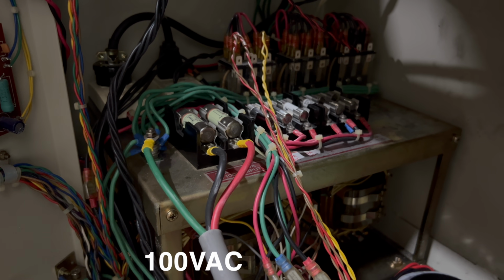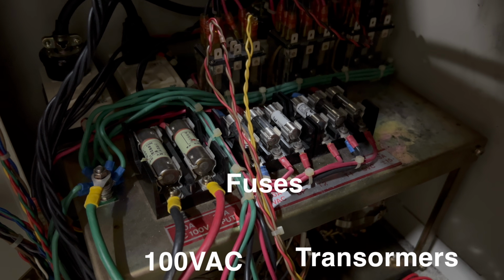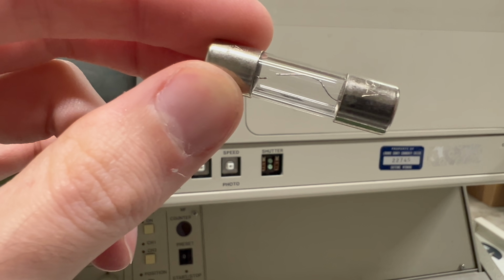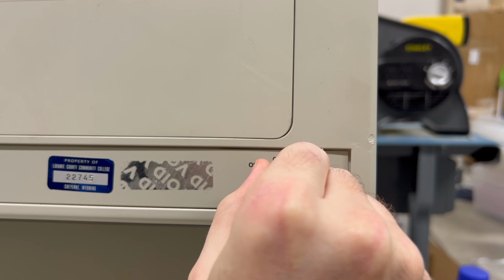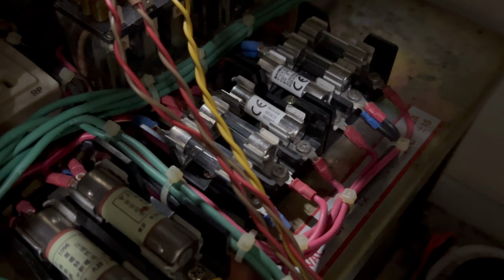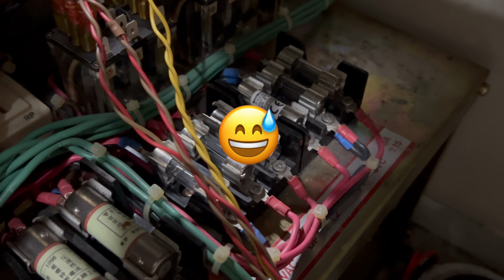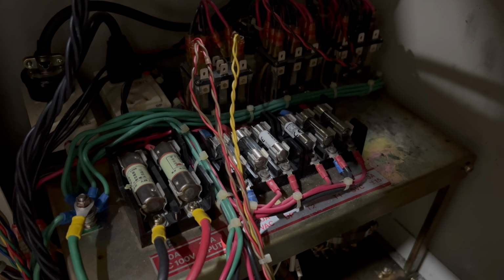It looks like the 100 volts comes in here, goes through a couple of fuses and a couple of transformers, which feeds a bunch of different power supplies. Well, right off the bat, I found a blown fuse. I replaced the fuse, turned the machine back on, and immediately blew the fuse again. Okay, I probably should have seen that one coming. Something downstream is clearly drawing too much current or is shorted out entirely.